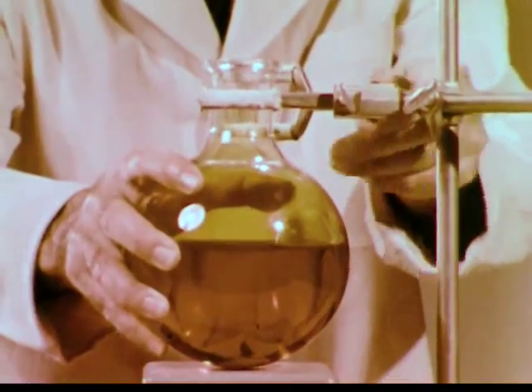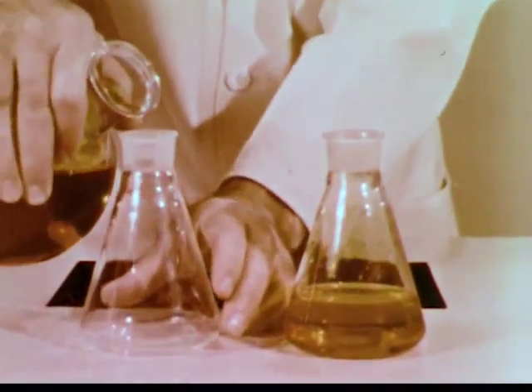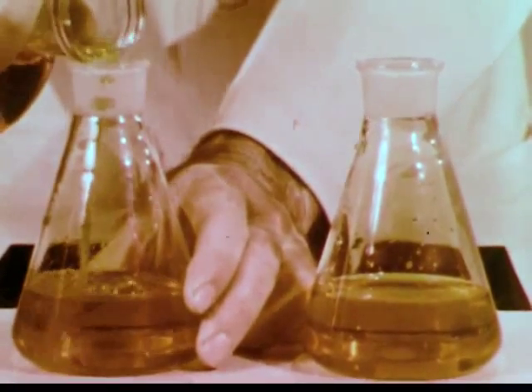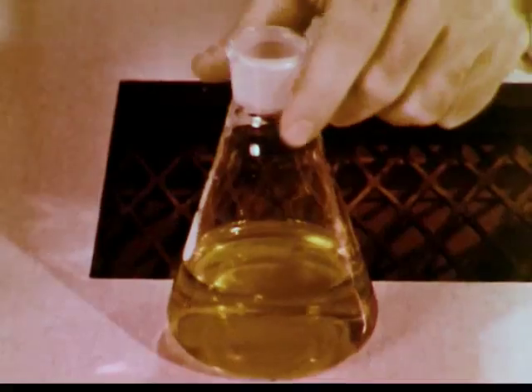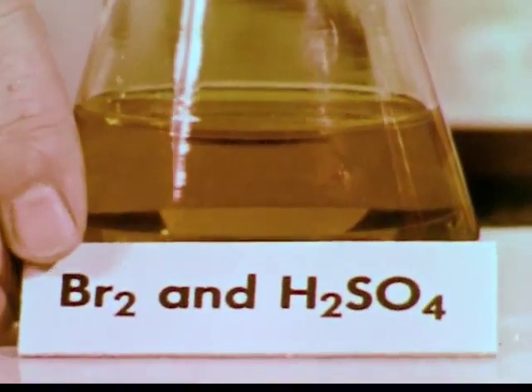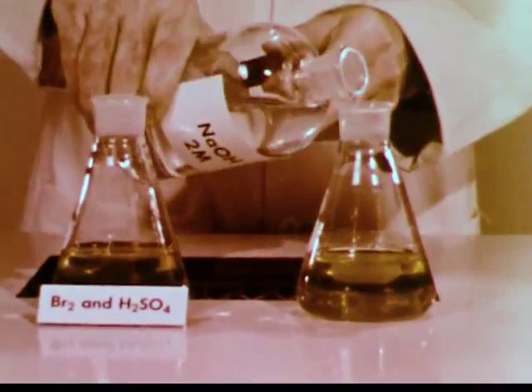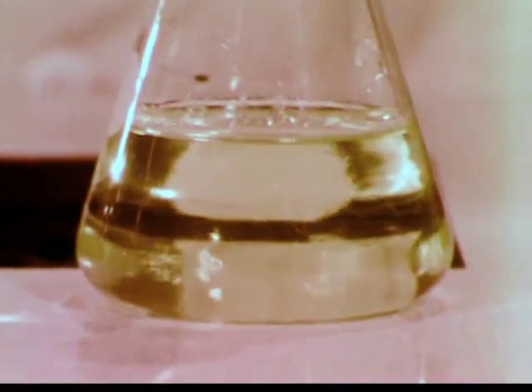What are some of the chemical properties of this aqueous solution? Let's divide the saturated solution in order to check the effect of varying the acidity. To this flask, we add acid. The color does not change appreciably. A base is added to the other flask. The bromine solution turns a very pale yellow, indicating that a reaction has taken place.